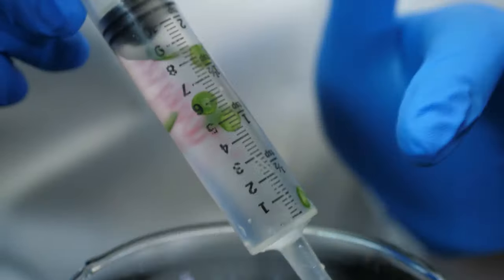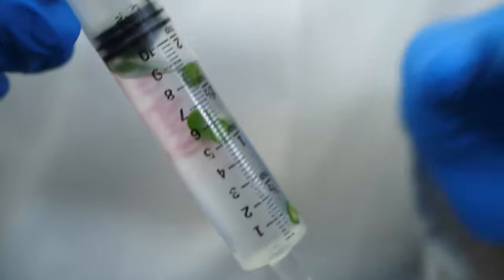If any chads are sticking to the sides of the barrel, we can dislodge them by tapping on the barrel.